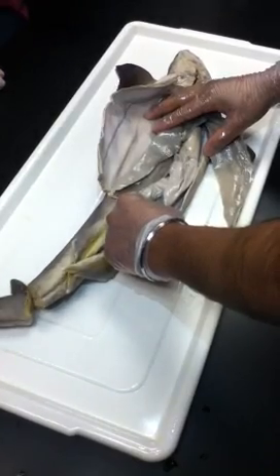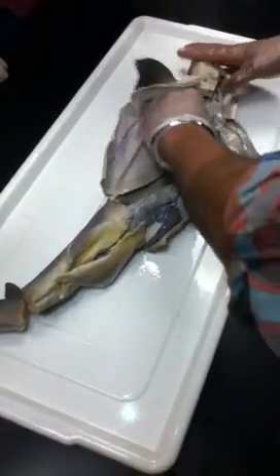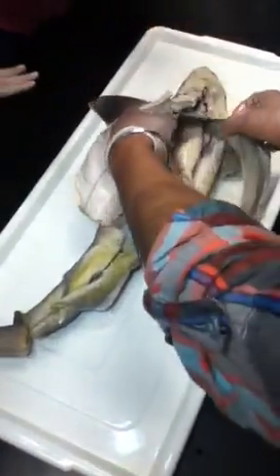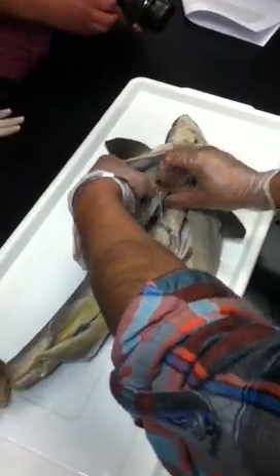Now, anterior to the stomach, you guys identified the esophagus, right? Right. This over here, we would say. No, this is over here. We were thinking beyond, above the stomach. So where was your stomach? Right over here. This whole structure. So just everything up beyond that. Right. Lift the liver up. No, I don't want to cut it.